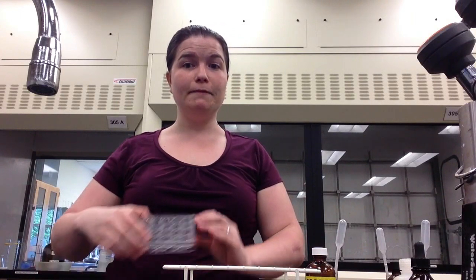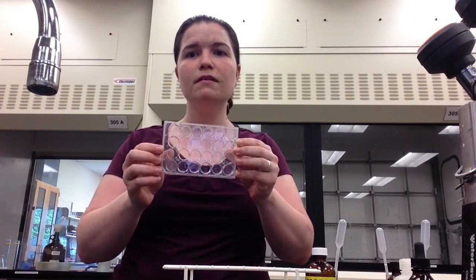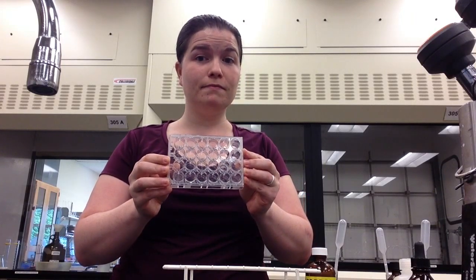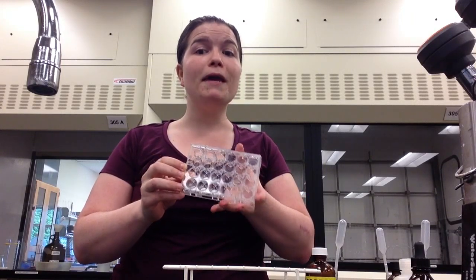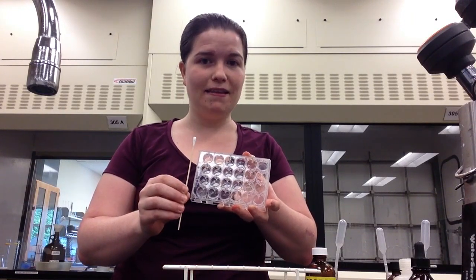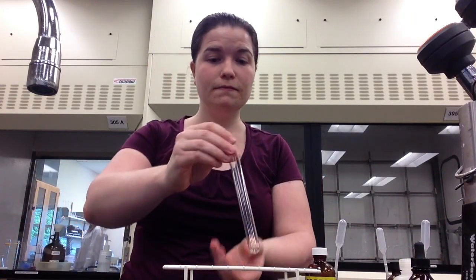In this lab, some tests will be conducted using a well plate. It allows for experiments to be done on a small scale and minimize heavy metal waste. The well plates can be thoroughly cleaned using a cotton swab at the end of the experiment. Other tests will be conducted in test tubes so that chemical reactions can be observed. Read the procedures carefully to ensure that you complete the tests in the correct container.